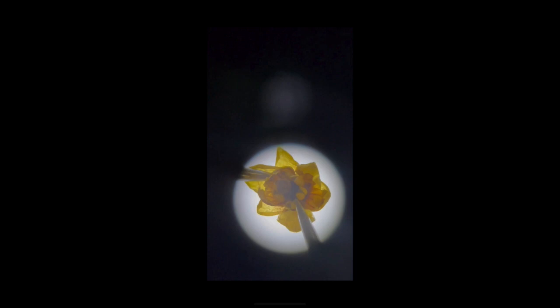Another thing that wasn't included within our specimen but is worth mentioning is the leaves. For Berberis, they also fit the family characteristics of Berberidaceae, as they are 1 to 10 centimeter long simple leaves, and these can have smooth or spiny margins.